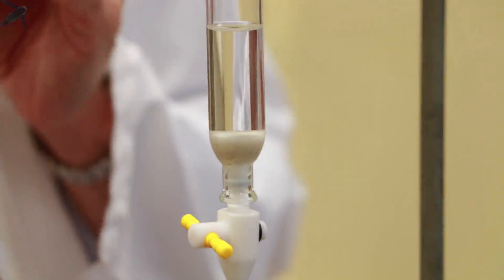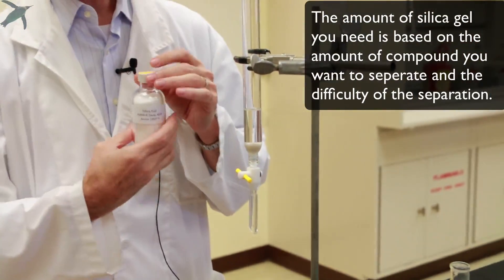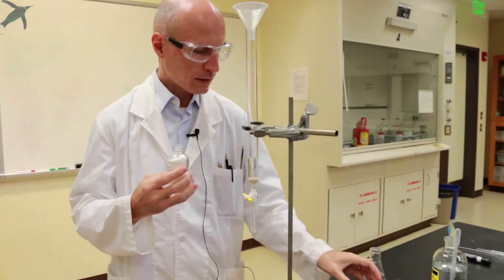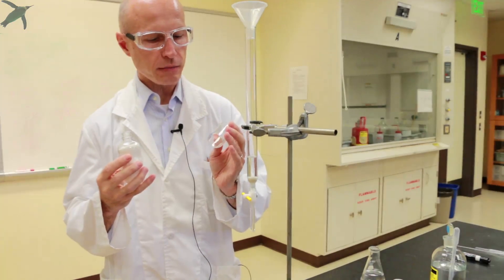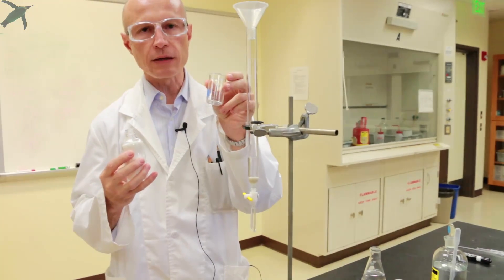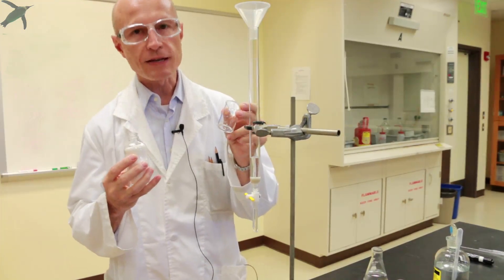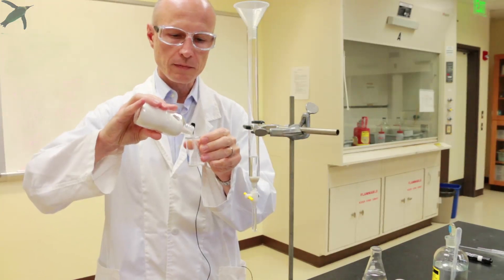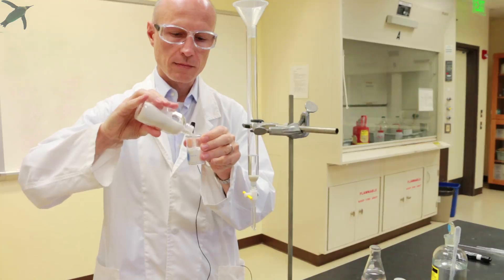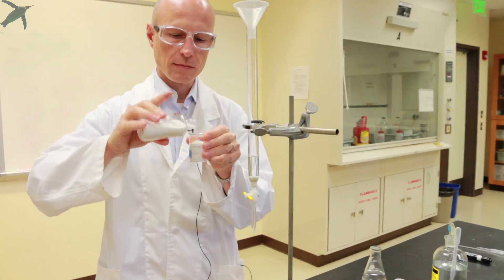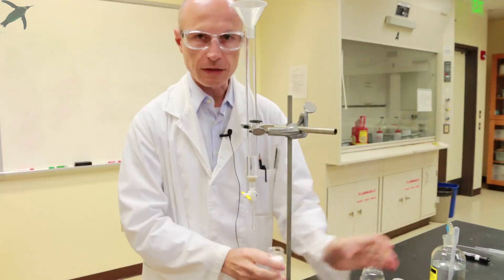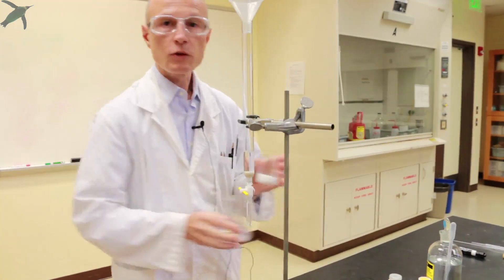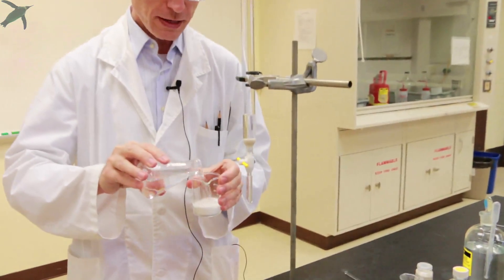You will need approximately 14 grams of silica gel. Dry silica gel has a density of about 0.5, so there's no need to really weigh it. It's going to be approximately 28 milliliters. So if you use a 30-milliliter beaker and you go somewhere between 25 and 30, it's plenty accurate. So that's what we are going to do. That's approximately the right amount. You transfer it into a bigger beaker and you want to make a slurry with your solvent. So you add enough solvent.